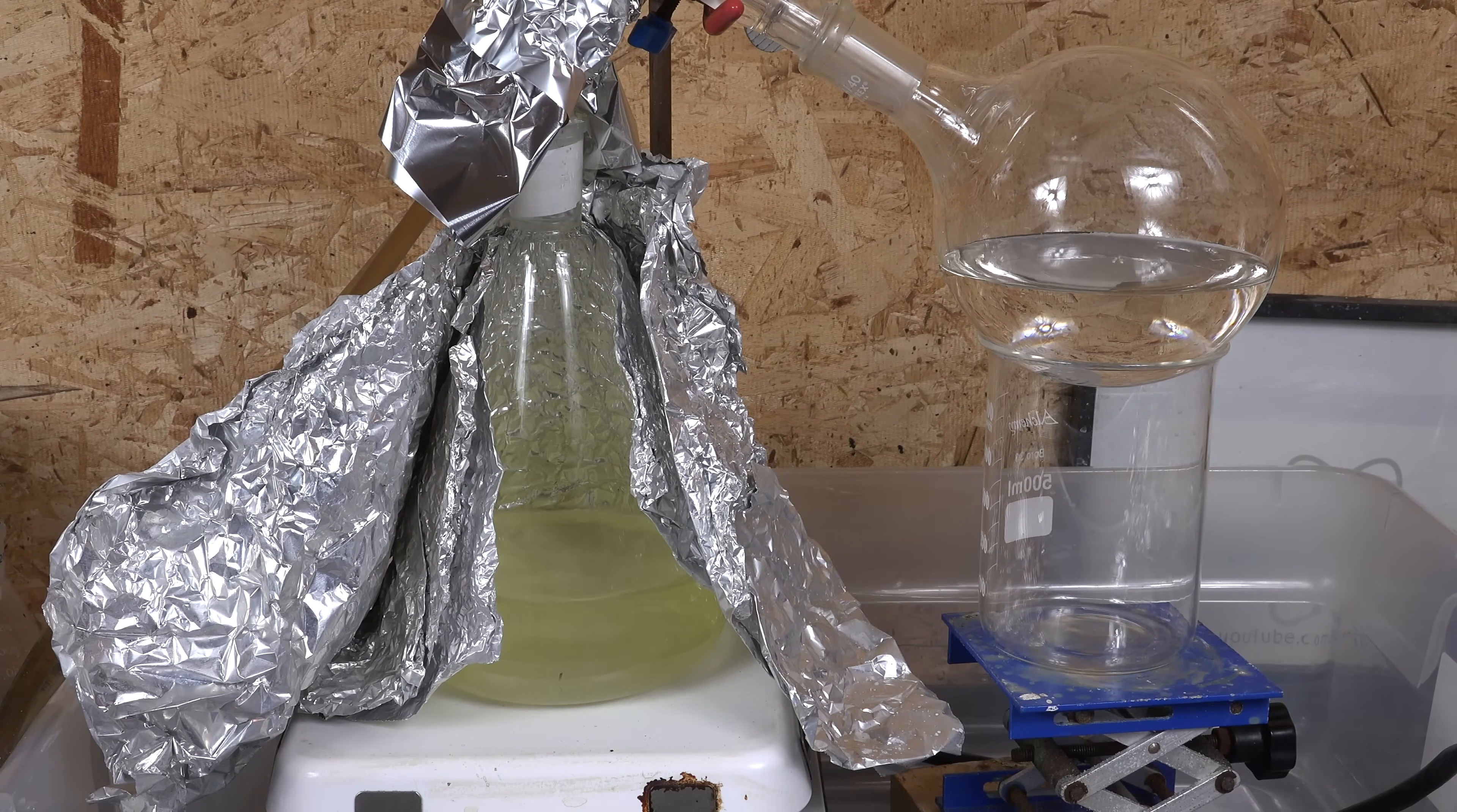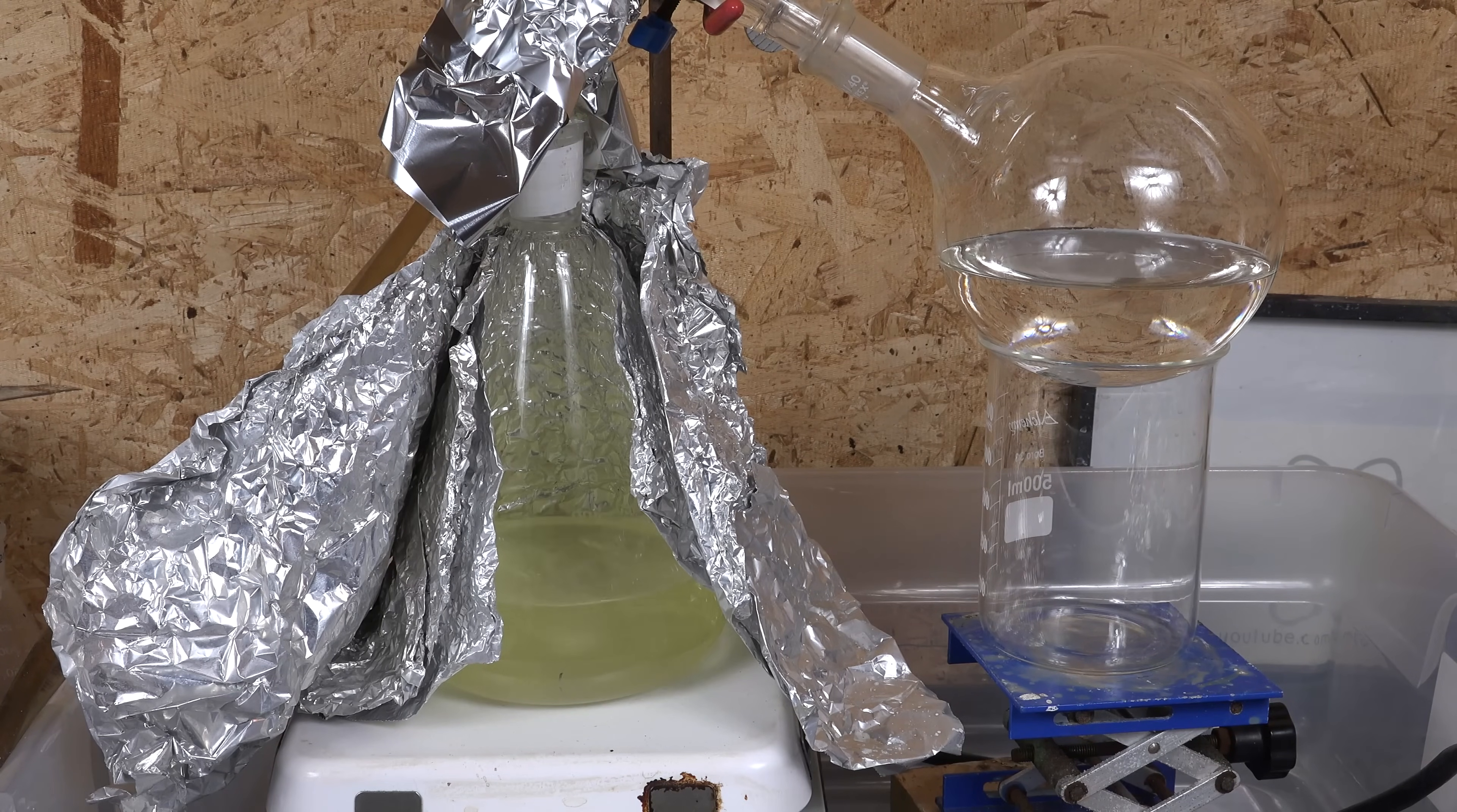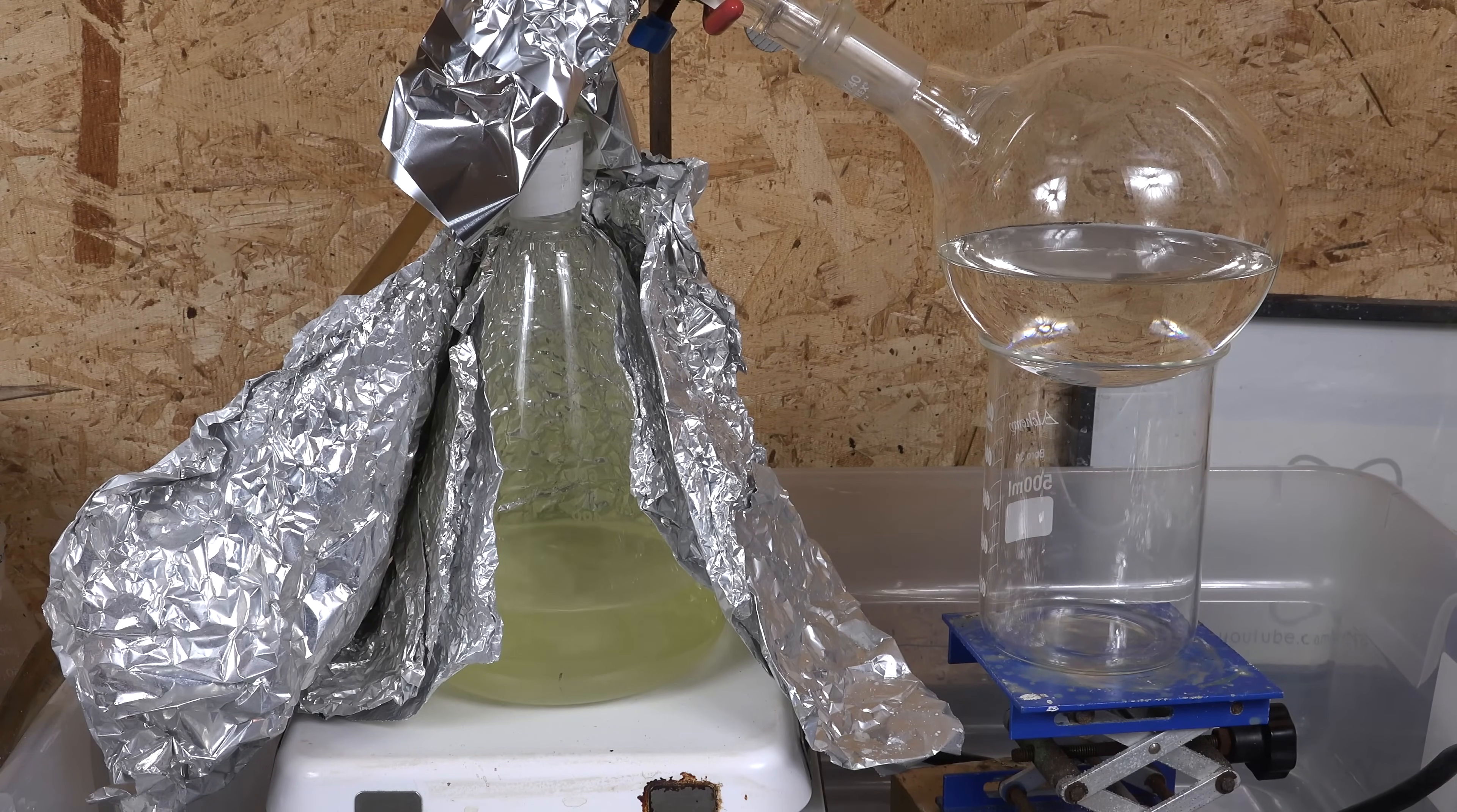At this point a lot of you might be terrified of boiling sulfuric acid now and you should be. As said before, distilling sulfuric acid is about the most dangerous procedure an amateur chemist is reasonably foreseen to do. Even most professionals consider it on the upper end of dangerous procedures. But as long as you respect those dangers and have proper safety procedures, it can be safely handled, contained and controlled, even in the event of a catastrophic failure.